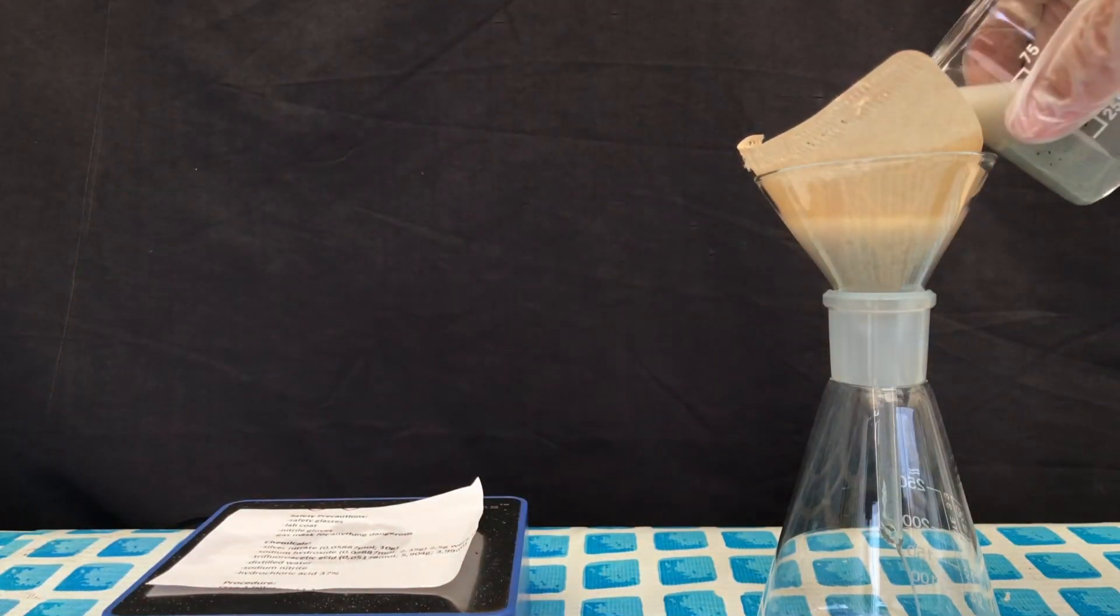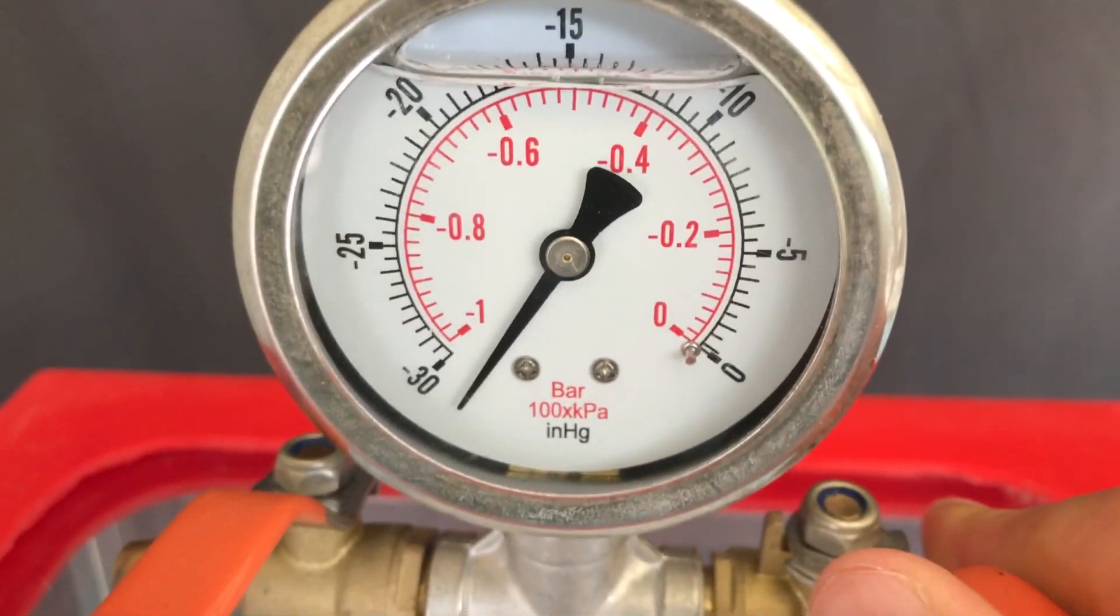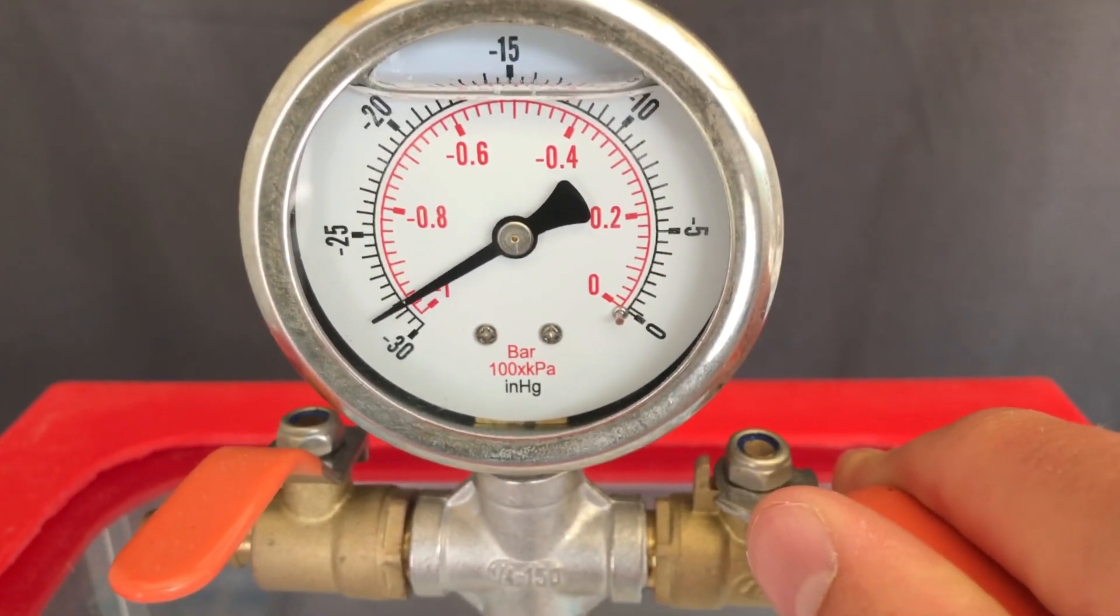A gravity filtration was performed. Everything was washed multiple times with distilled water. Afterwards the stuff was left to dry in a vacuum. The vacuum chamber was flushed back with air and we are finished.